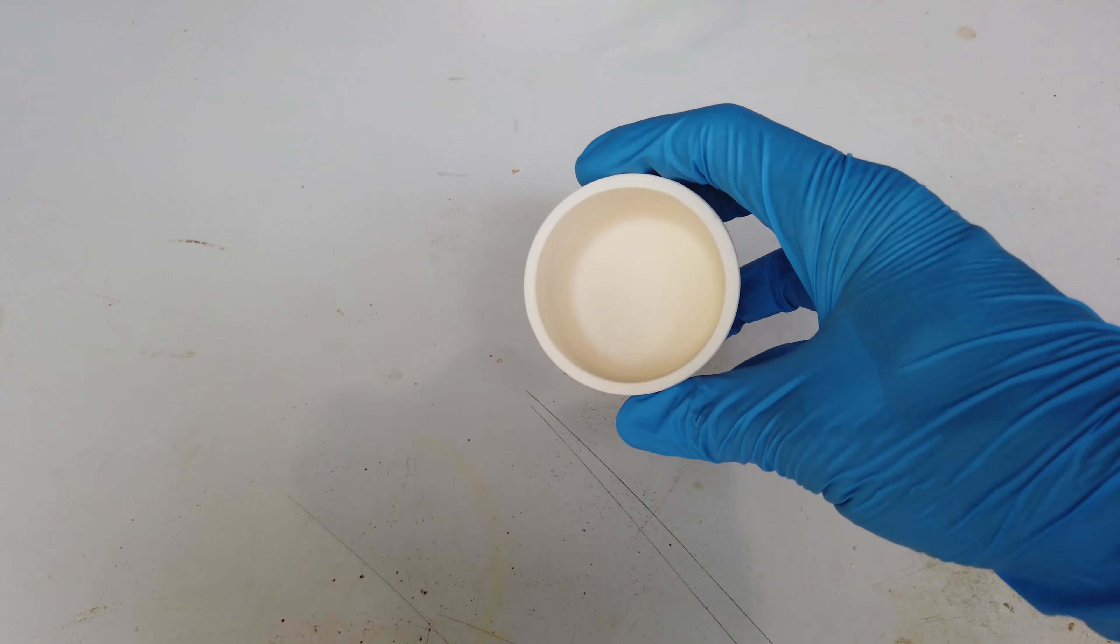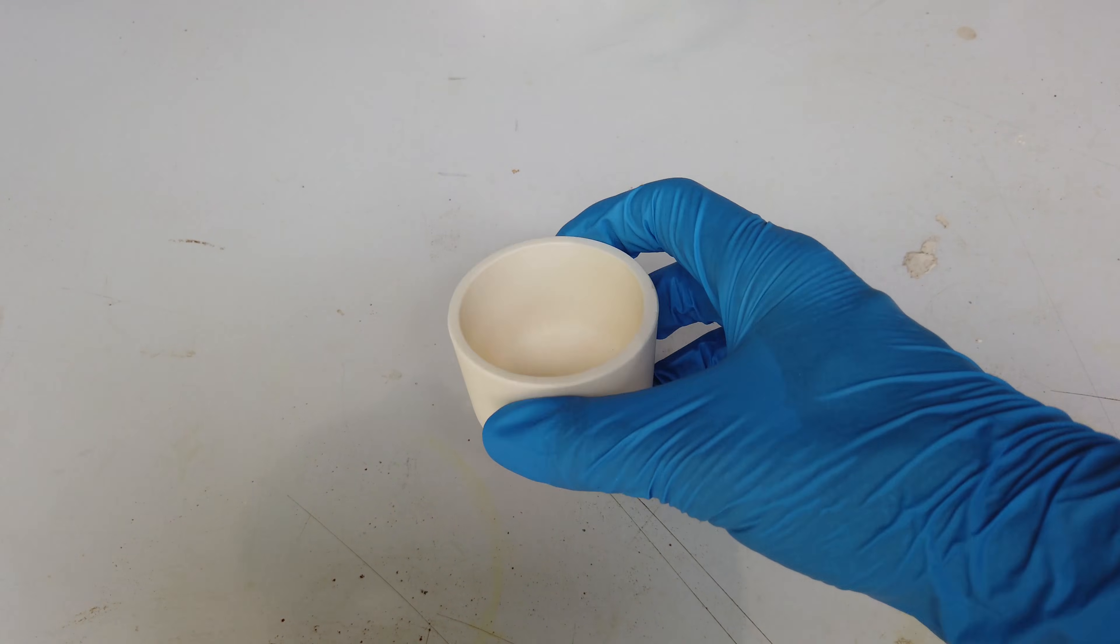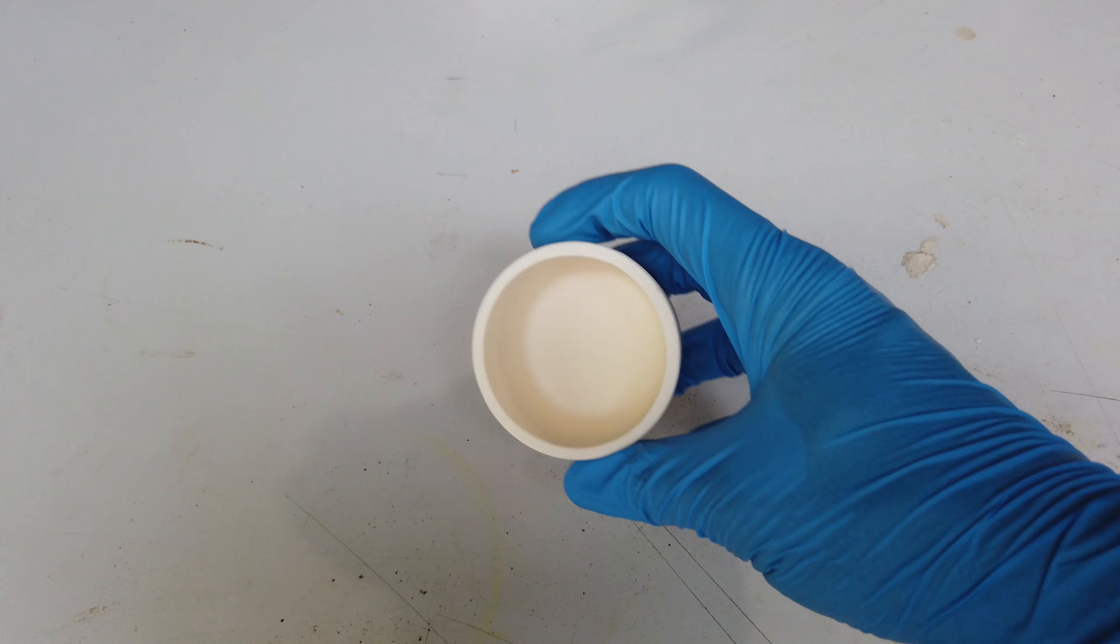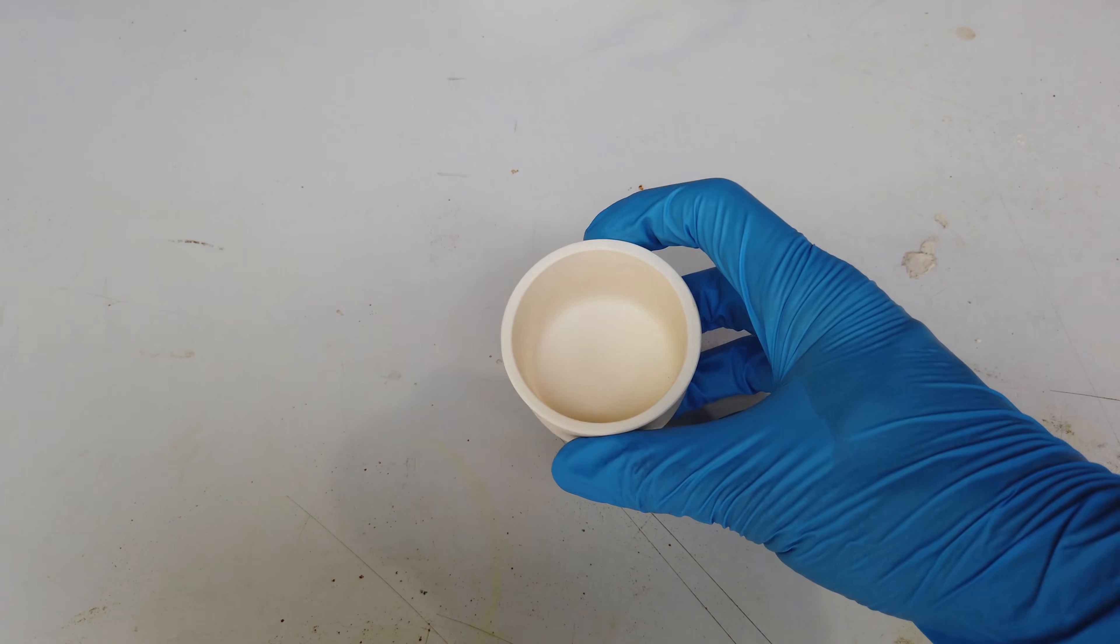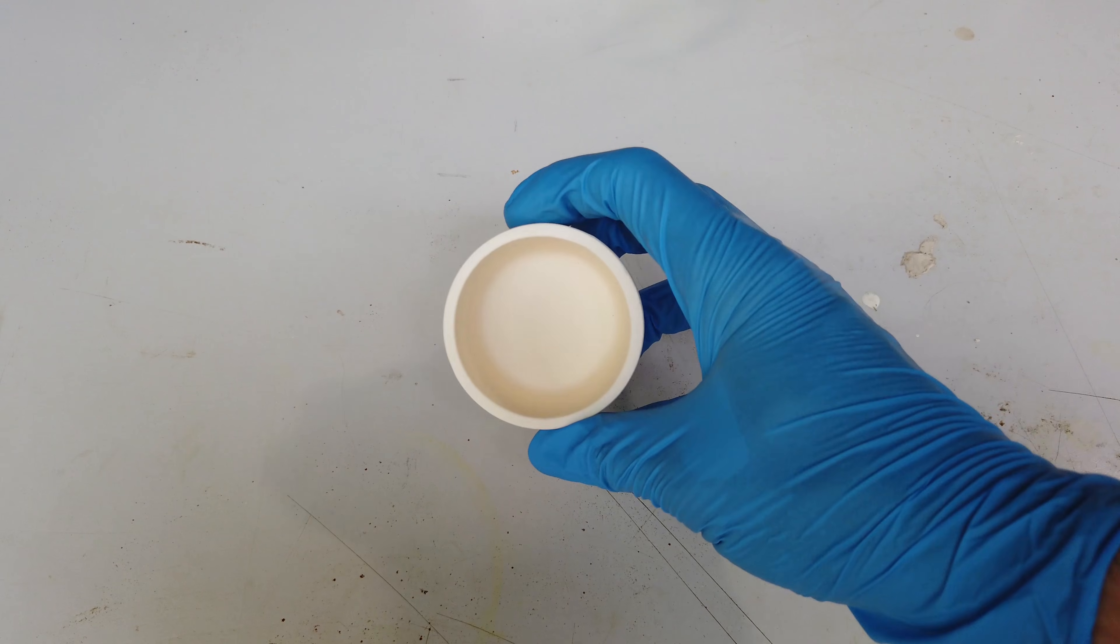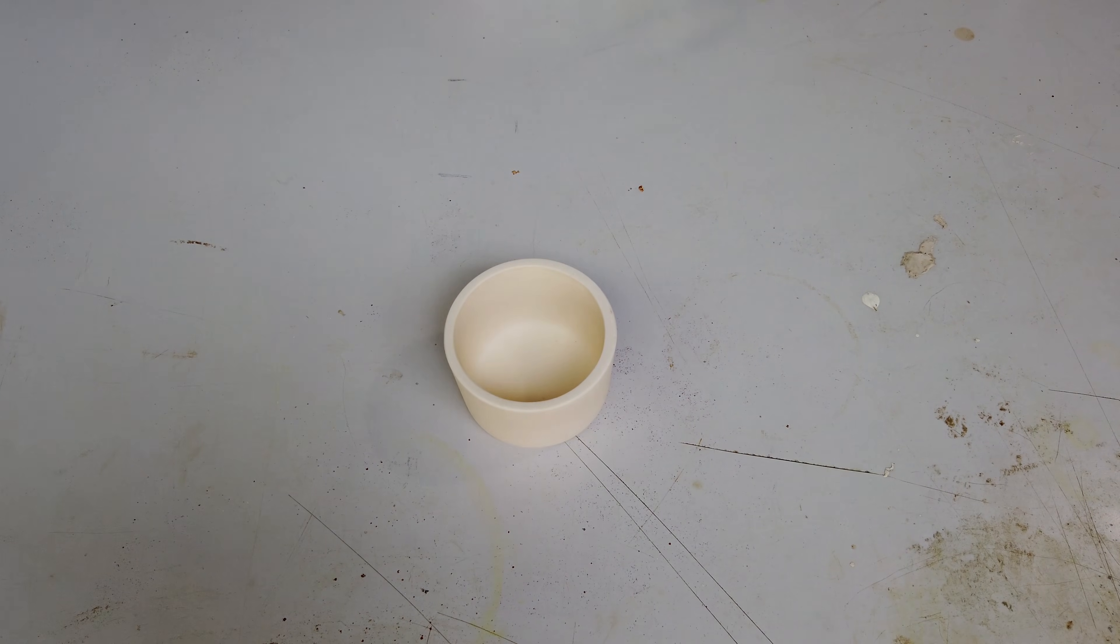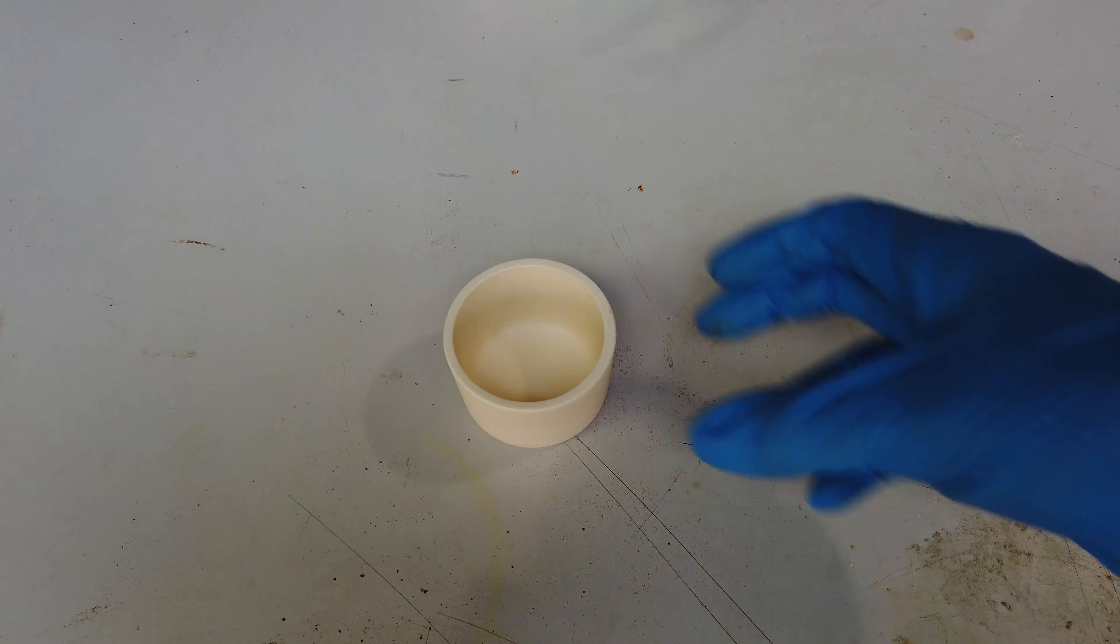A lot of people will probably say that I could just get a better grade of stainless steel, but to eliminate the problem entirely, I have gone and bought this thing. It's not going to be overly useful. The only real use cases I can see for this thing are melting sodium hydroxide and potassium hydroxide. But we've had some big struggles with making potassium metal and we need all the help we can get. I know we did it before in a previous episode, but let's melt down some sodium hydroxide and make some more sodium, I think.